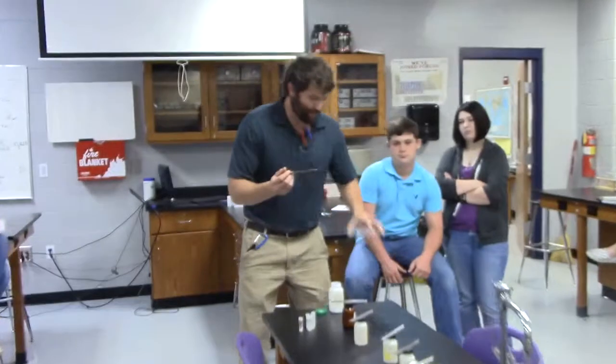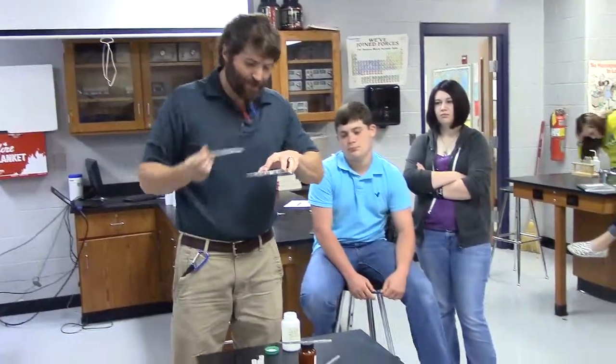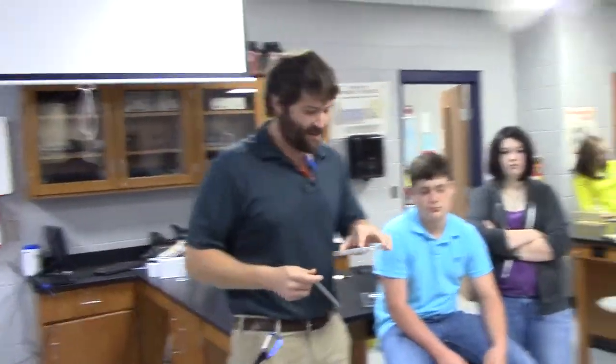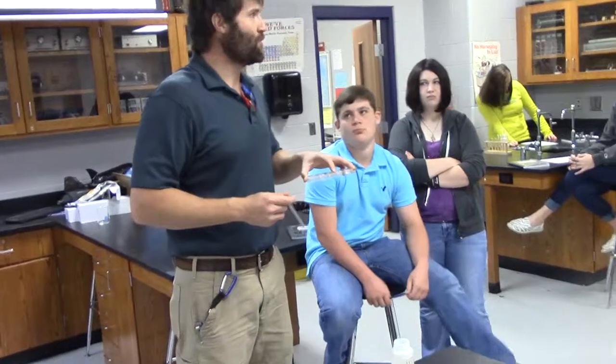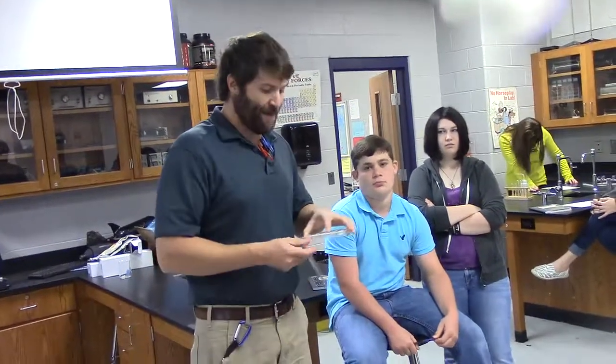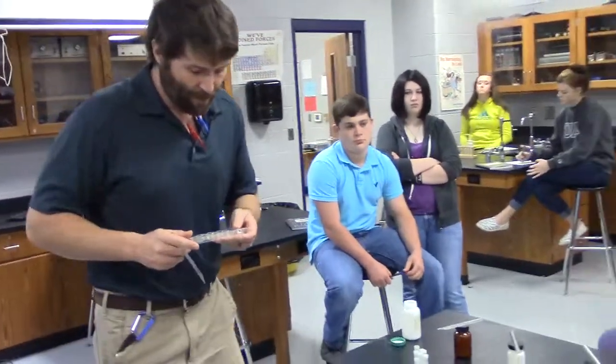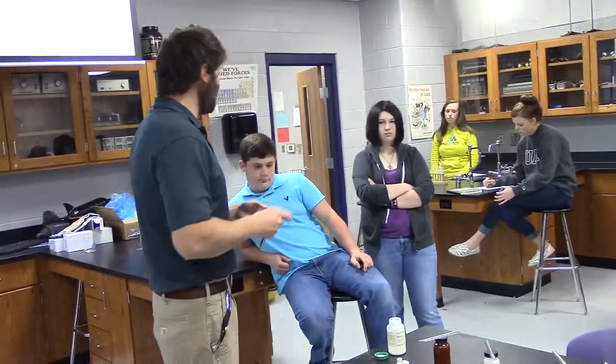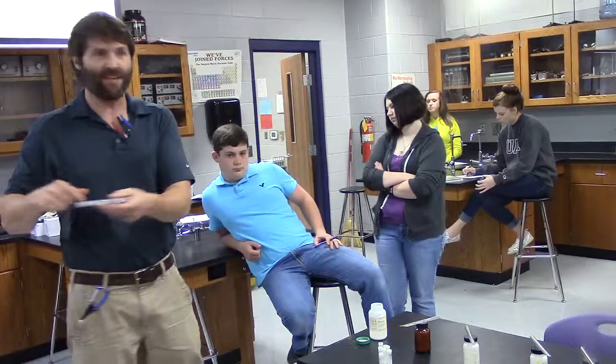I'm trying to keep you from walking in and taking like some gigantic scoop of something and then us throwing most of it away because this stuff costs money. So I'm going to come over. And what I would do is, and this is where some of you will goof up. Some of you will go through here, get one of everything, and then you'll sit back down and go, I don't know which one's which anymore. Which means it might be a good idea there's numbers on here. If me and Logan are in a lab group together, I might go, Logan, number 1 is barium nitrate. And Logan can write that down for me, and when we go sit down, we'll know what everything is, right?